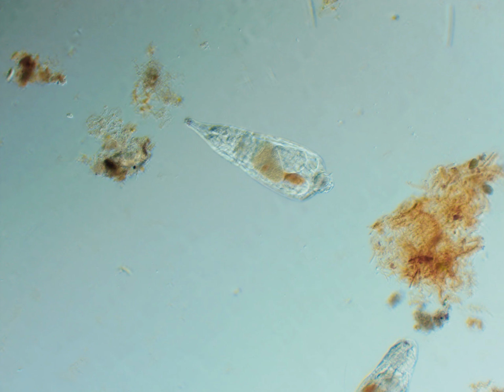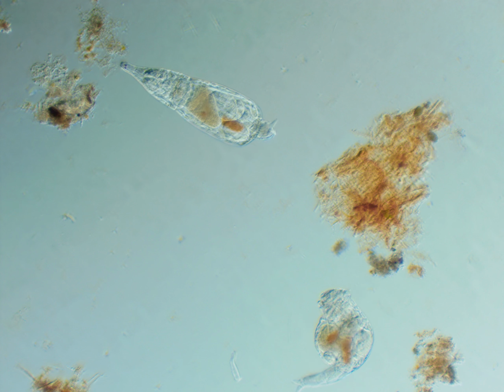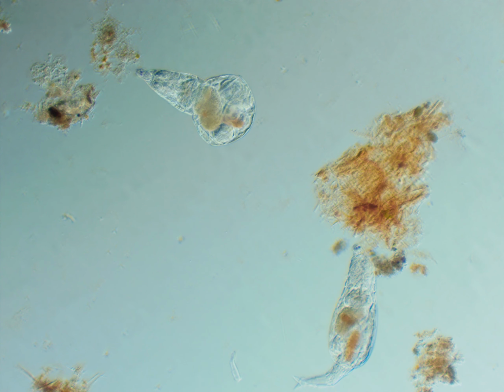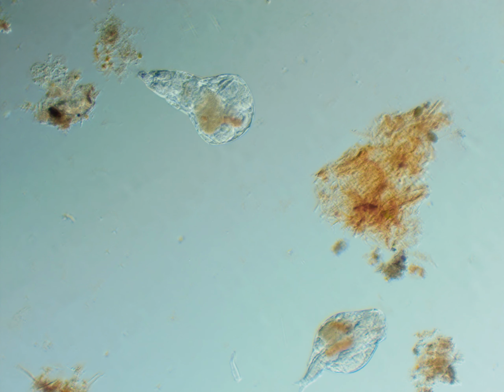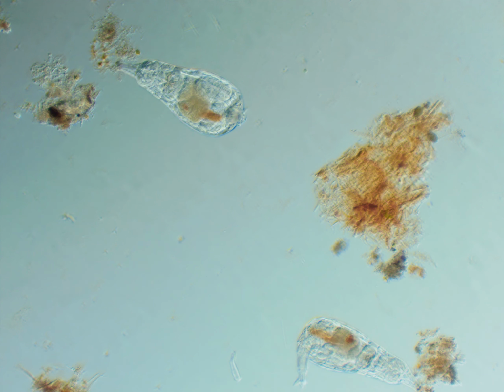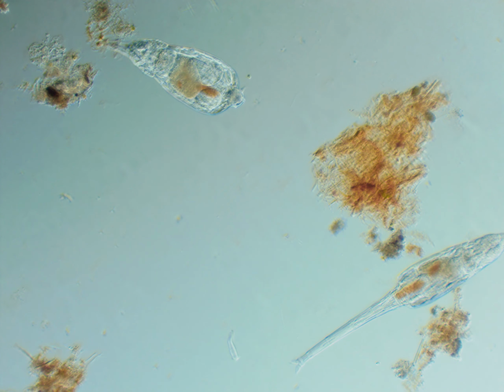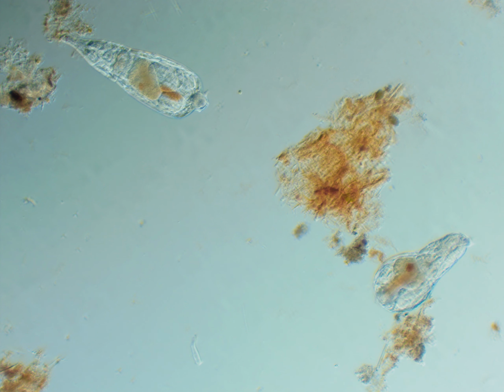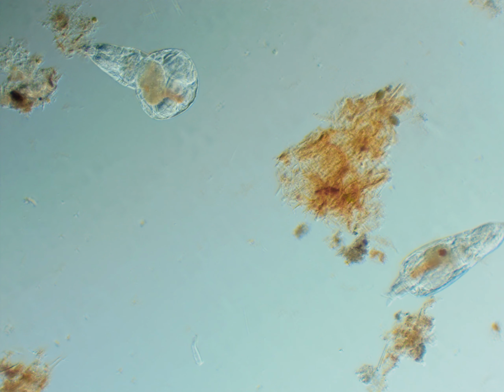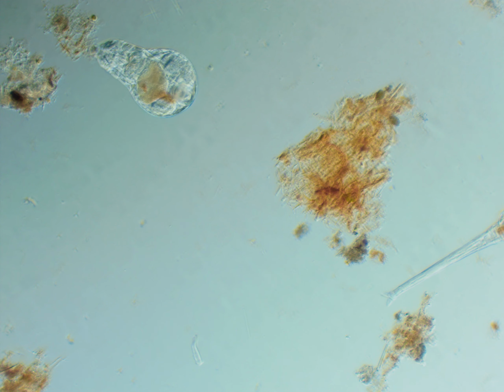See? And here's another clip of two of these bdelloids together. You can see them moving around there. That one to the bottom right is attached to the top of the cover slip. They do that a lot. It just disconnected. They usually connect to things before they open up their cilia, because that could possibly move them.